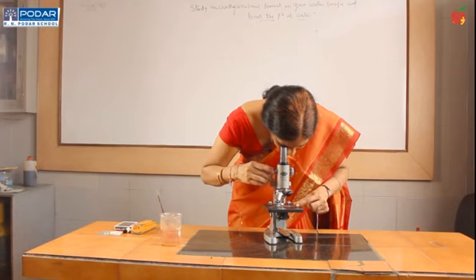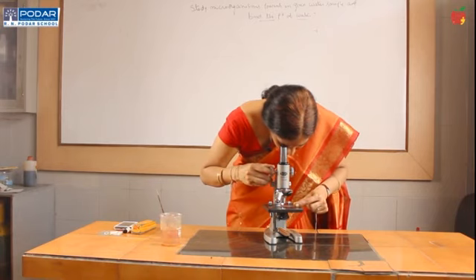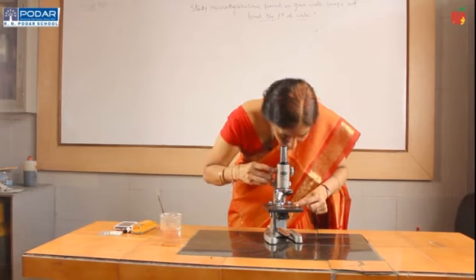Just imagine the purity of the water we are drinking. This water is not suitable for drinking at all because these organisms are taking a lot of oxygen from the water. So, the water now has very low oxygen levels. Dissolved oxygen levels will come down as BOD goes up. So, the purpose of this experiment is now explained like this. That is all.